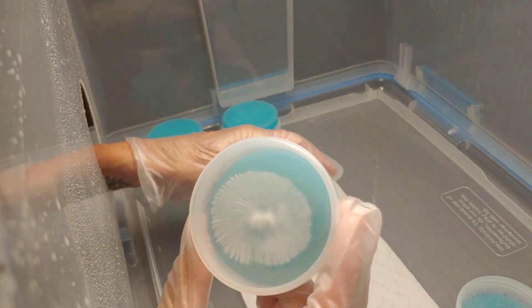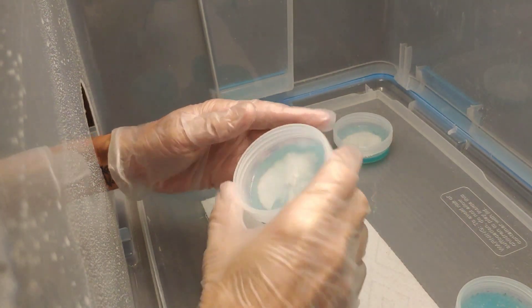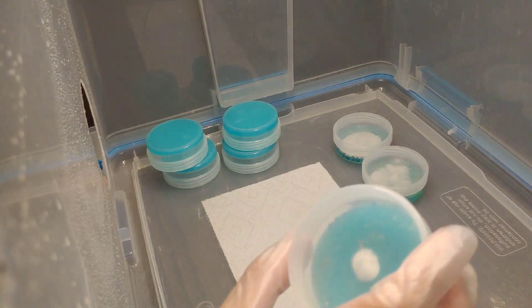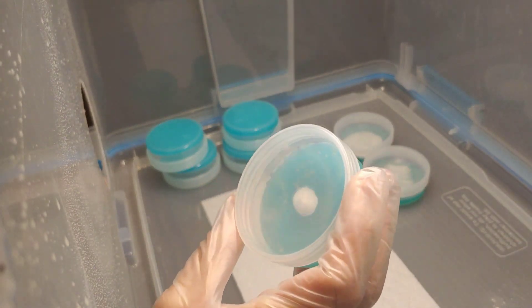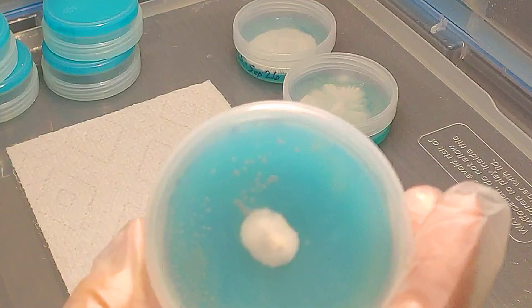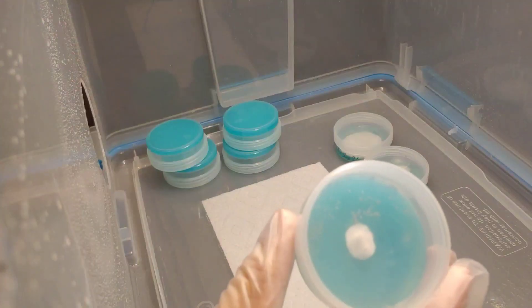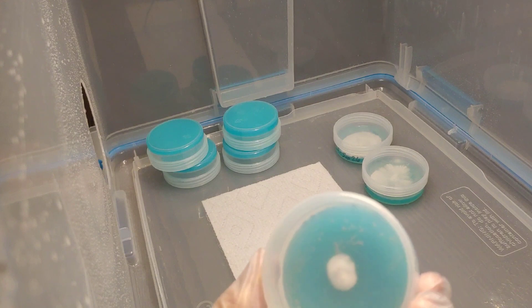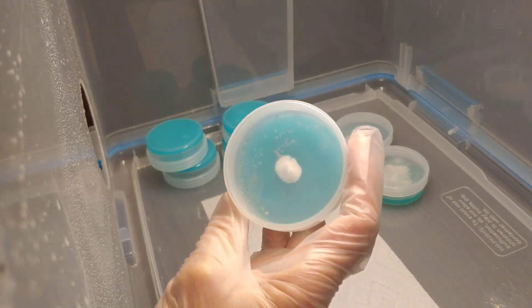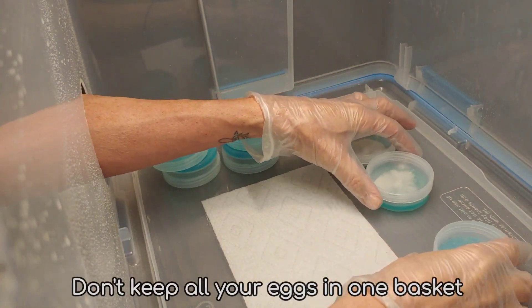So we can say that this is the strongest one, and then this will be the second one. This one just didn't — it's just way too slow, and it has these little dots around here that don't look good to me. So this one I would not use: one because it's so slow, and two because it has some funky stuff growing around there. It did not do well, and this is why one of the mantras is: don't keep all your eggs in one basket.